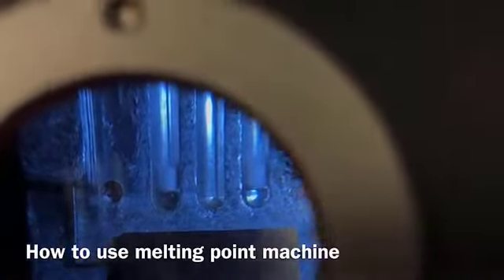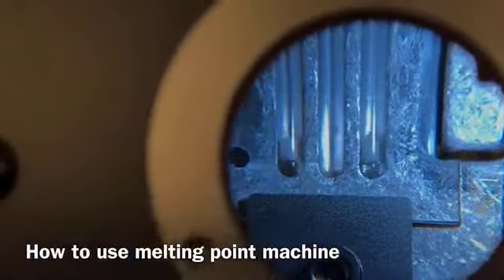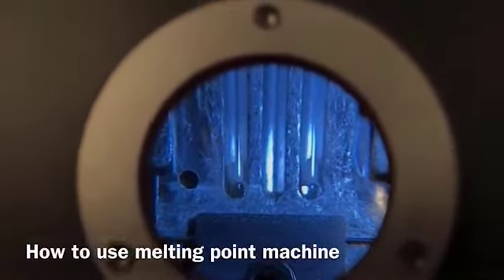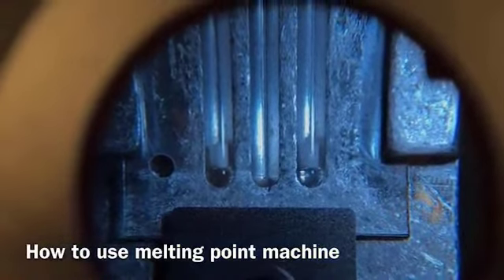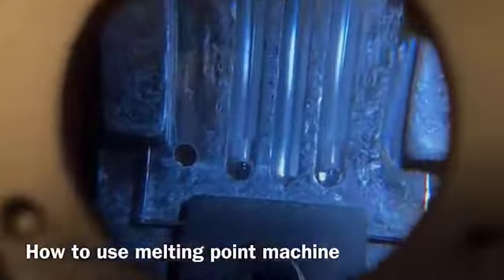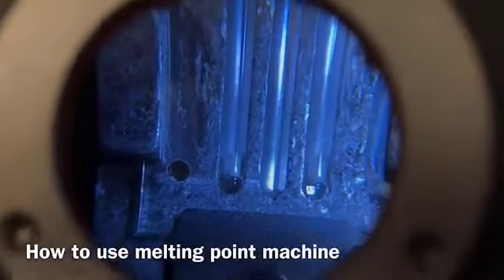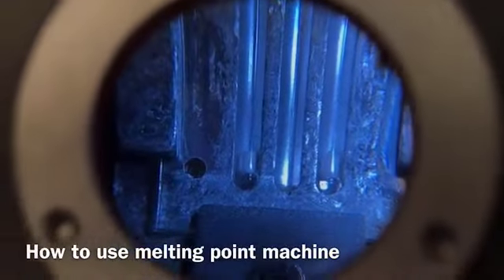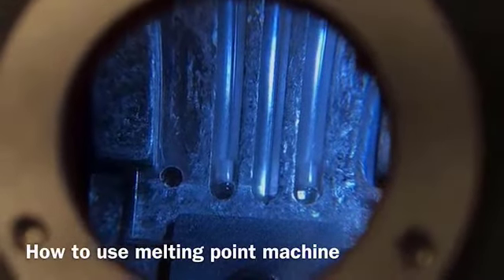So you are going to record the range of the melting point. The range means once you see the very first drop of the liquid in the capillary tube, that's your starting range, and once you see all the sample melted, that's the end of the range. So the melting point is always in a range, starting and ending.